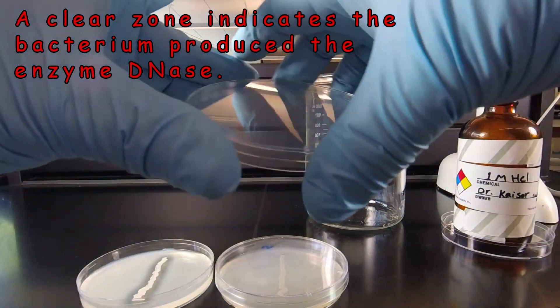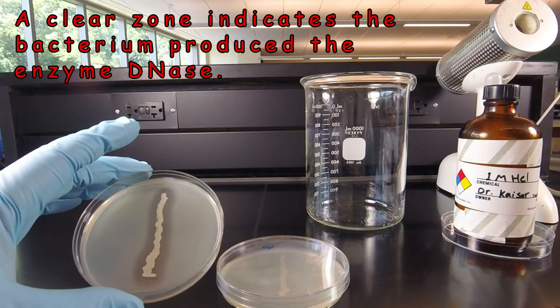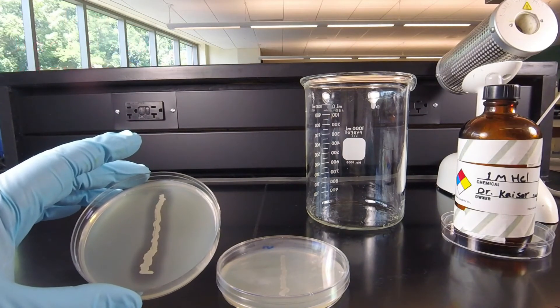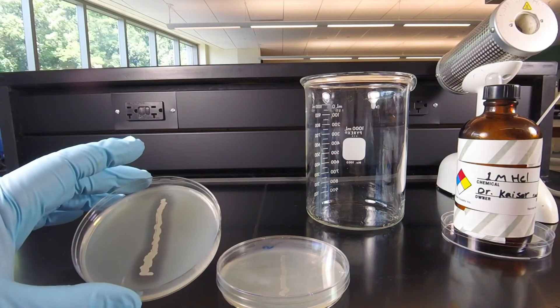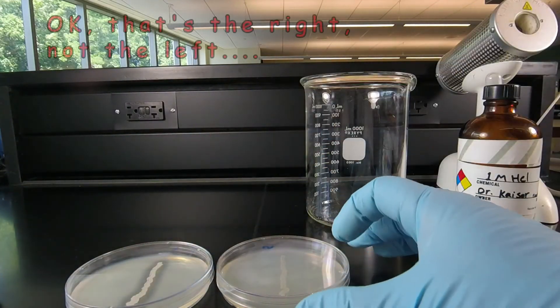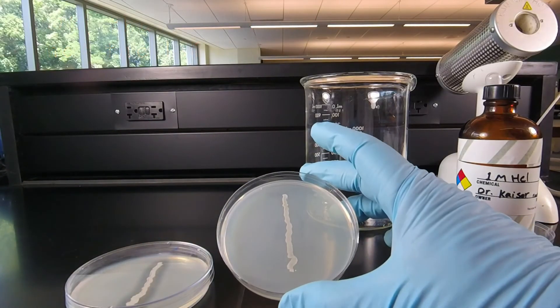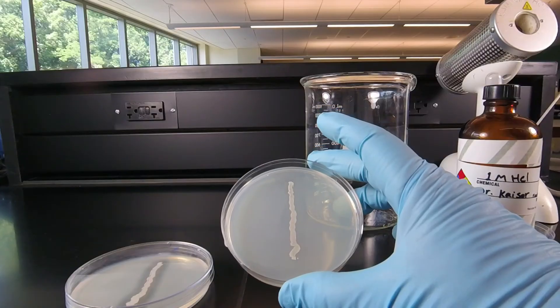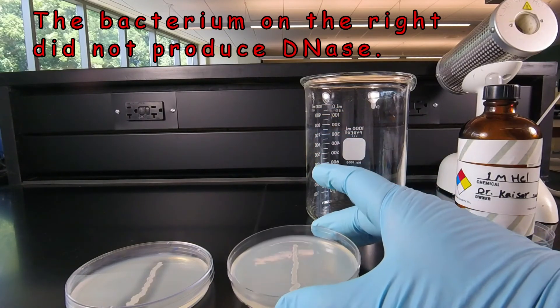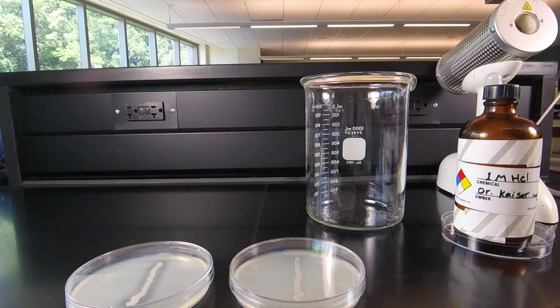The DNA was hydrolyzed by the DNase of the bacterium. So this bacterium is DNase positive — we see a nice clear zone around the growth where the DNA has been broken down, characteristic of Staphylococcus aureus. For the organism on the right, there's no clear zone around the growth; the agar has turned opaque, so that organism is DNase negative, which is characteristic of other species of Staphylococcus.